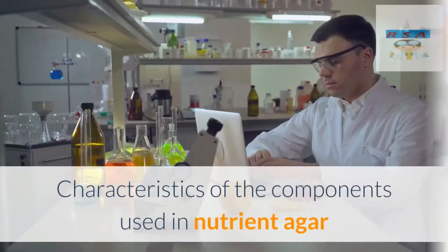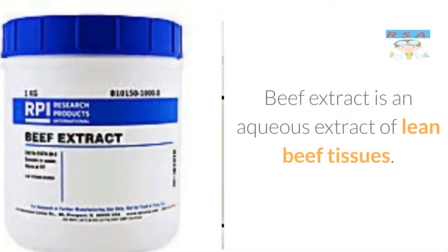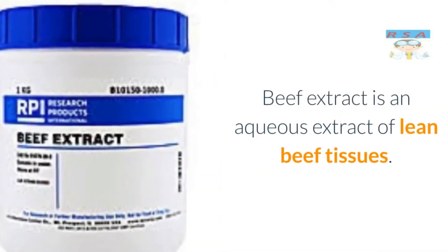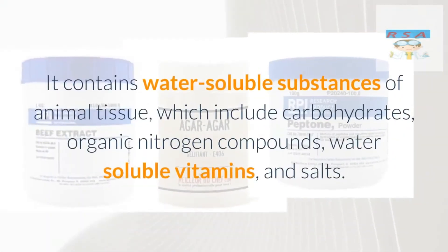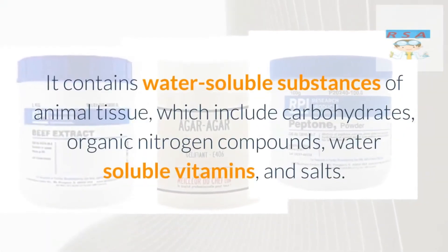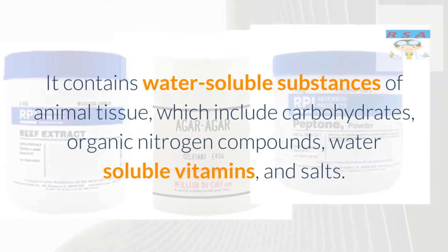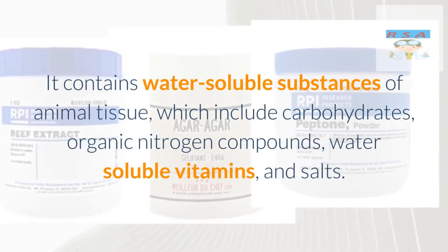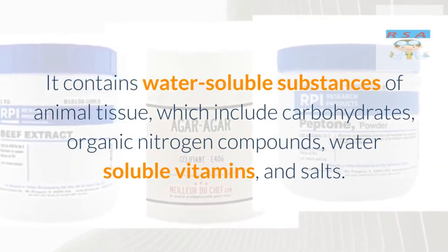Characteristics of the components used in nutrient agar. Beef extract is an aqueous extract of lean beef tissues. It contains water-soluble substances of animal tissue, which include carbohydrates, organic nitrogen compounds, water-soluble vitamins, and salts.